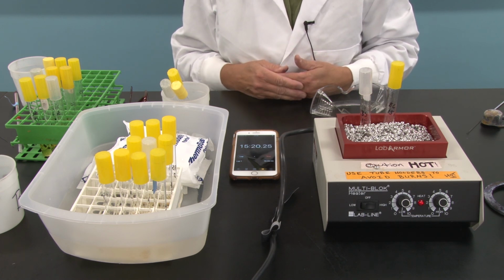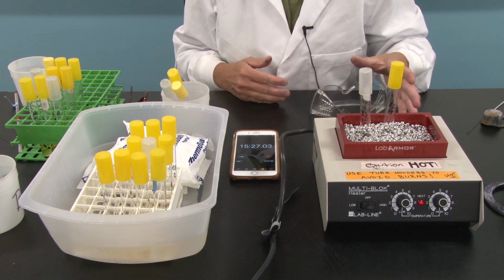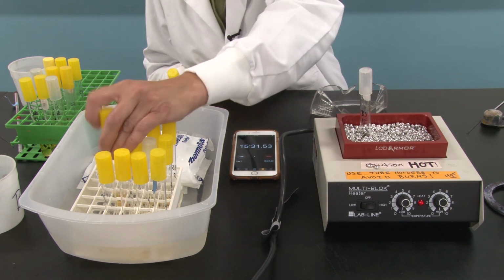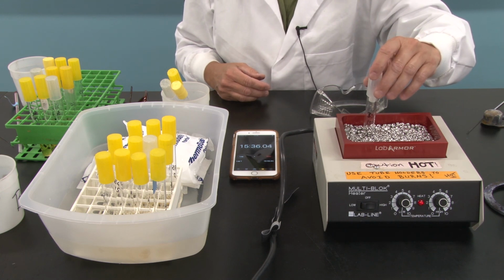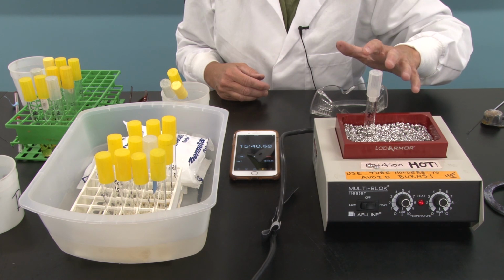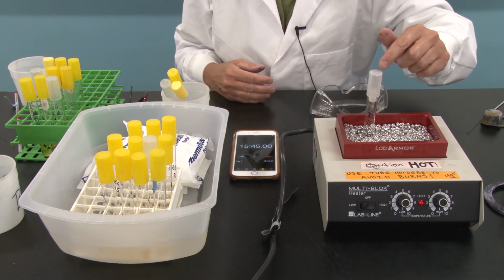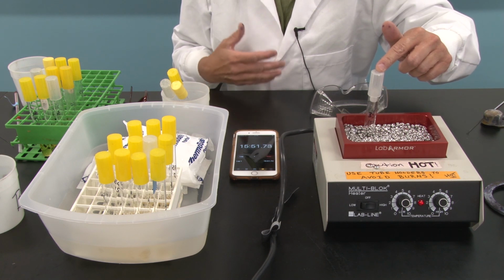And let's recall what we're trying to determine. We wanted to cool them immediately so that they didn't remain boiling. We wanted to see how effective 1 minute was of boiling to kill E. coli, Staph aureus, and Bacillus, 5 minutes of boiling, and 15 minutes. So now what we need to do is we need to place these nutrient broth tubes in the incubator to see if there's anything living in them.